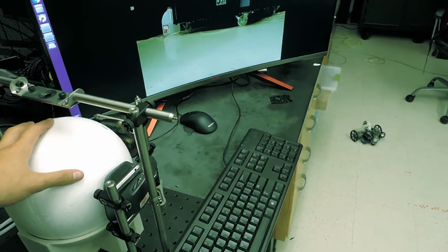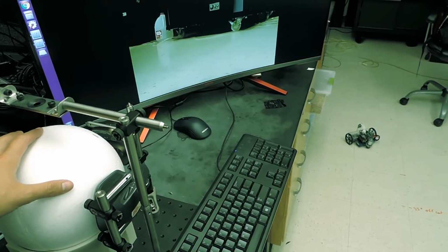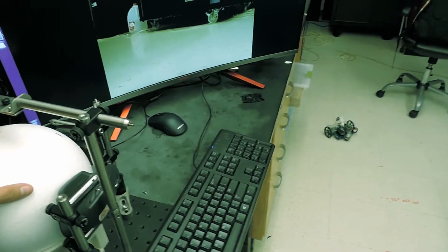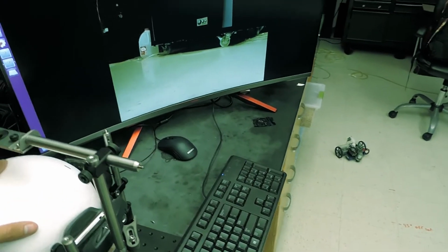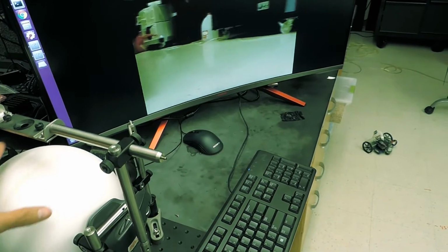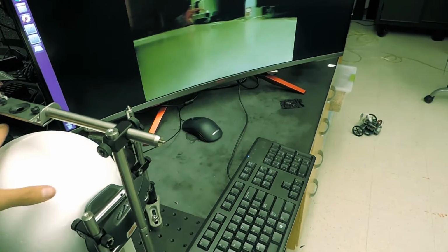Alright, it's a little tricky to capture all of this in one frame and control it with the other hand, but I'll do my best. So here we have the trackball motion, and pulling it back should result in a forward motion.